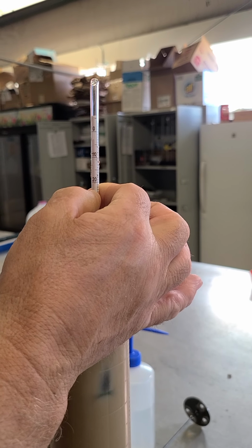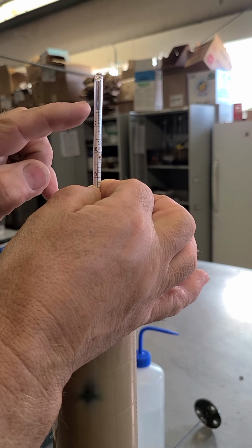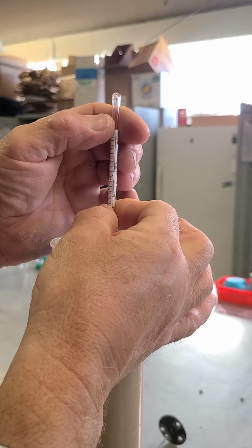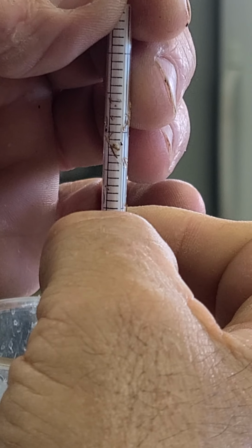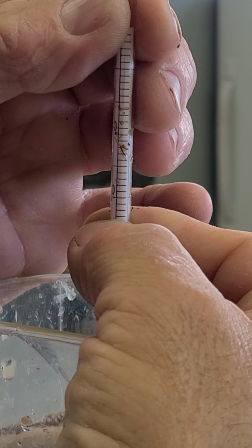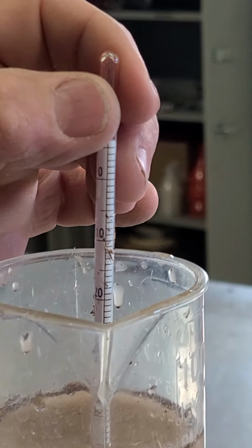Now I've recorded it, so I can pull it out. You can see there's a mark there. They're just numbers right through here. These units are calibrated, but I forgot what they are. I'll have to look and see what they're calibrated at. But right there is where the top of the water was, the meniscus. Remember, water is going to run up the side of this glass tube, but where the top of the water line was, right there at 24, right where my thumbnail is, was where the water level was at 40 seconds. So that's important to know.